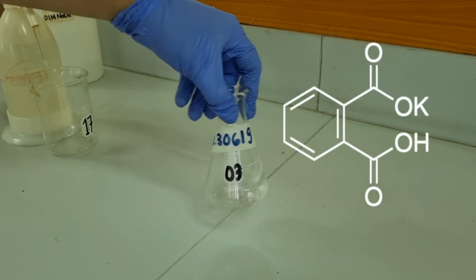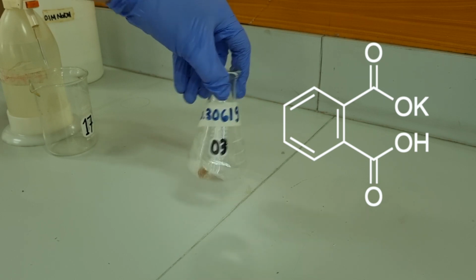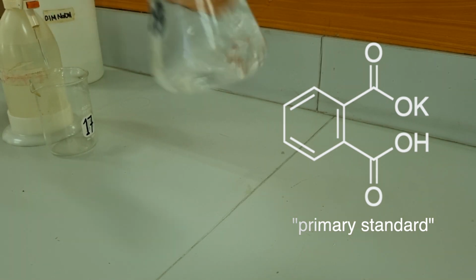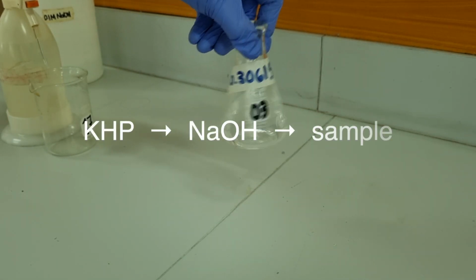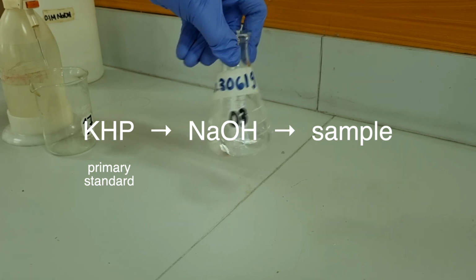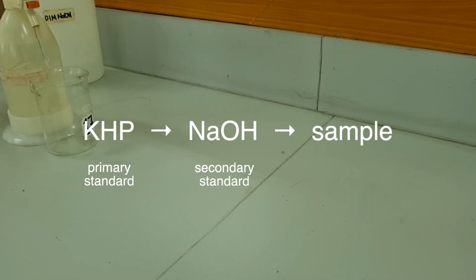KHP is a molecule with one acidic hydrogen, so it reacts in a 1:1 mole ratio with my base. KHP is what we would call a primary standard. It has features that allow us to accurately describe how many moles of it there are. By doing this standardization procedure, I'm using my primary standard to also accurately know the moles of my base for a certain volume. This converts my base into what we would consider a secondary standard. After standardization, I could then use the standardized sodium hydroxide to titrate with other samples.